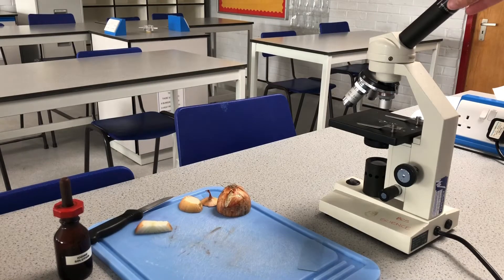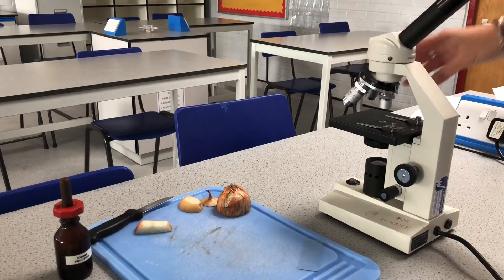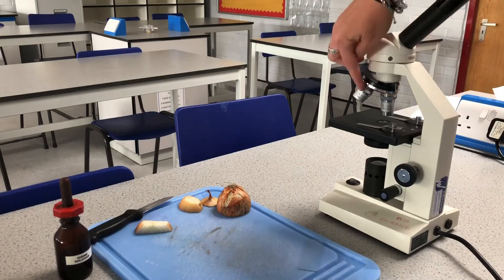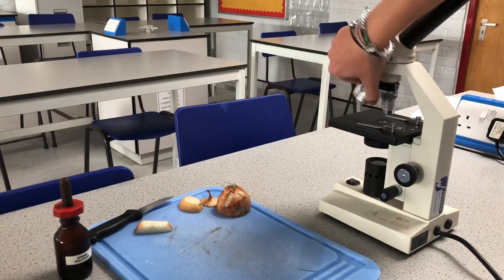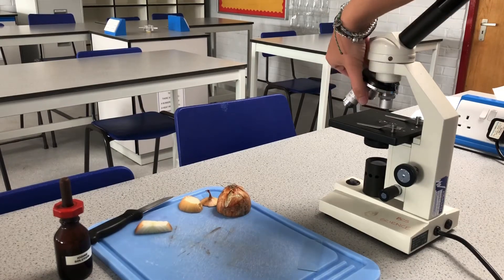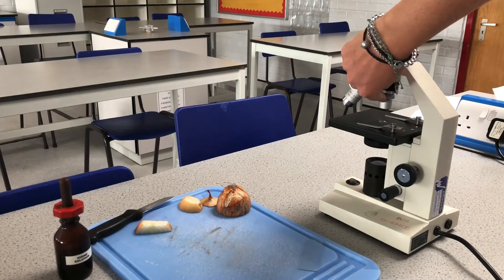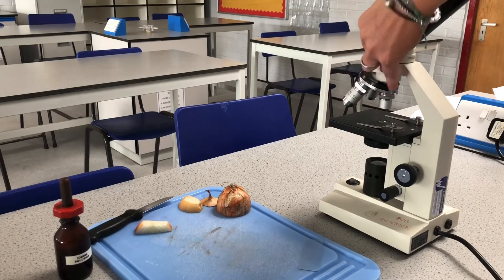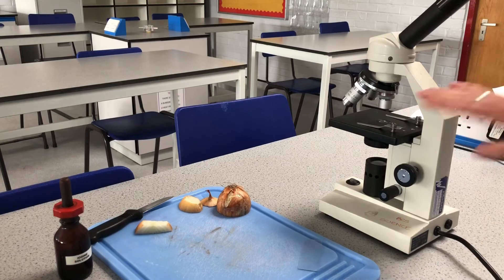We have an eyepiece lens at the top and objective lenses at the bottom. There are lots of different sizes of objective lens — a red one which is times four magnification, a yellow one which is times ten, and a blue one which is times forty. We choose the lowest magnification first and click it into position.